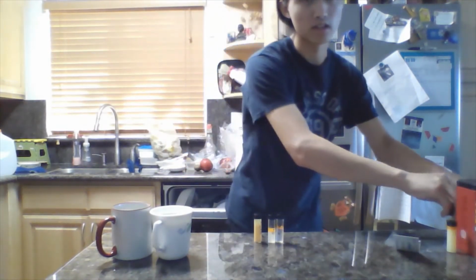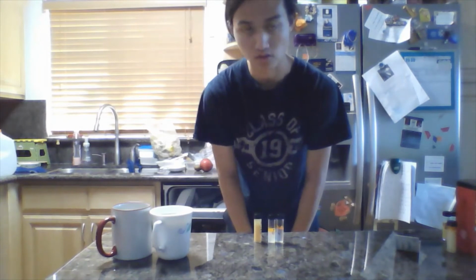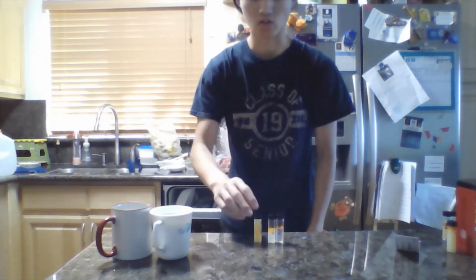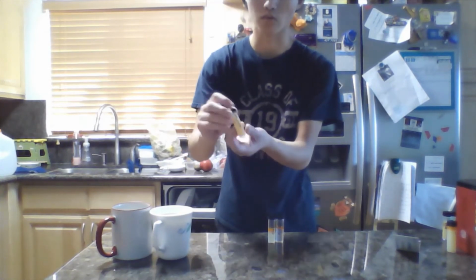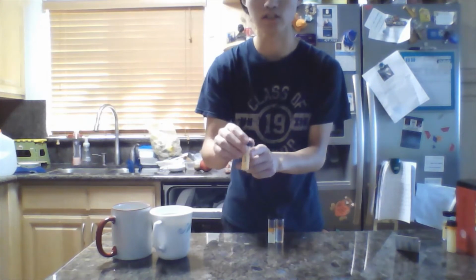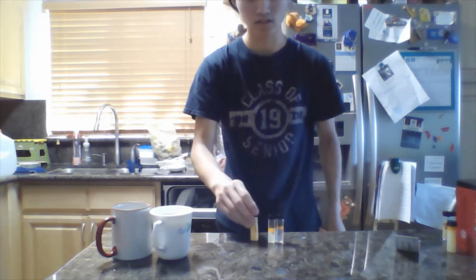So that's something very significant about the use of egg as an emulsifier. In order for it to work, your solution will have to be primarily oil. Hence, when I redid this vial, I ended up using a much lower concentration of citric acid and just added more egg yolk.